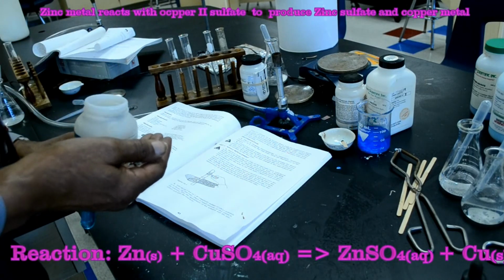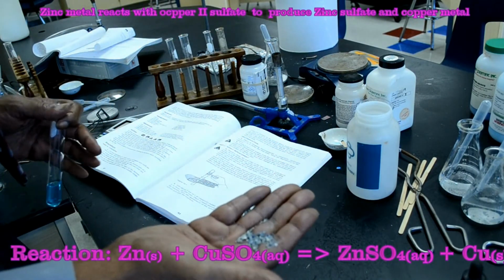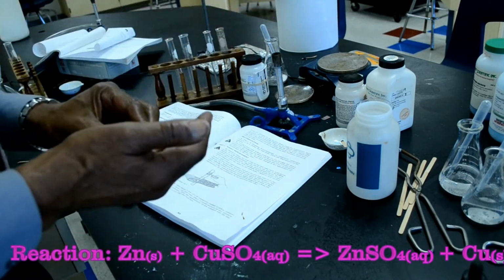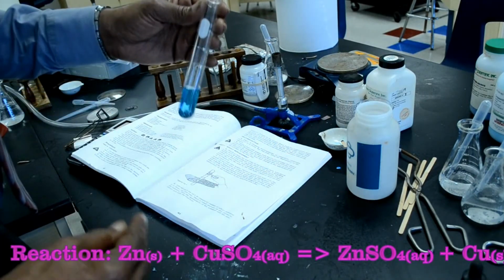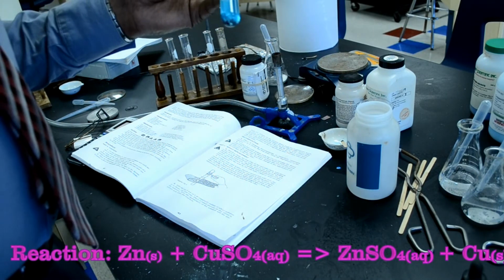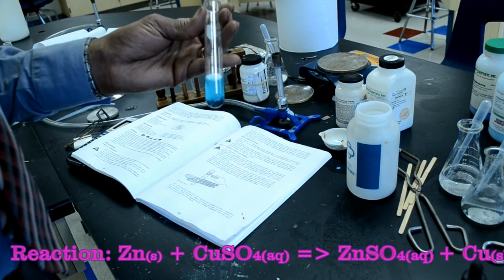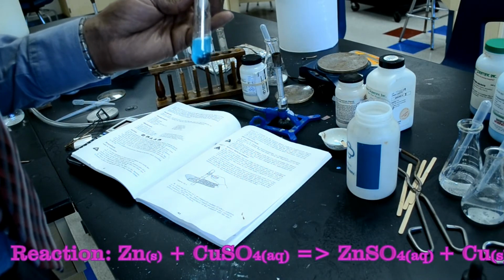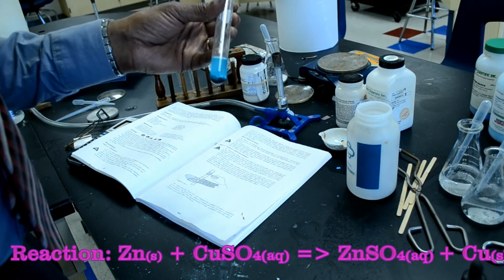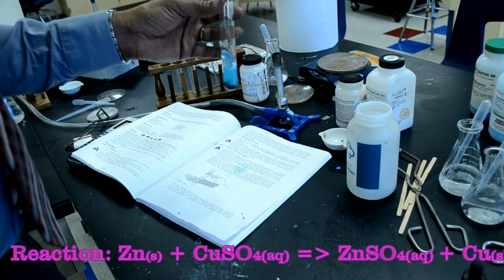So zinc is a substance that's actually a silver color, and this is a blue color. I'm going to place some zinc into the test tube, and immediately the zinc starts to turn a dark, almost black. And it's actually starting to create a gas a little bit. So I'm going to leave my zinc.